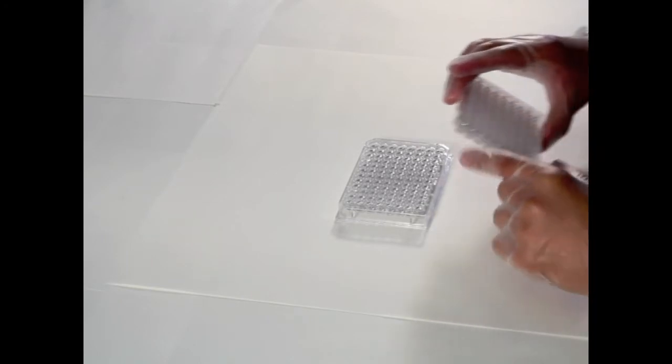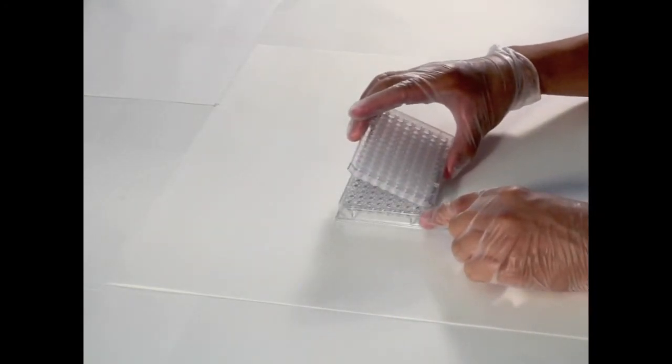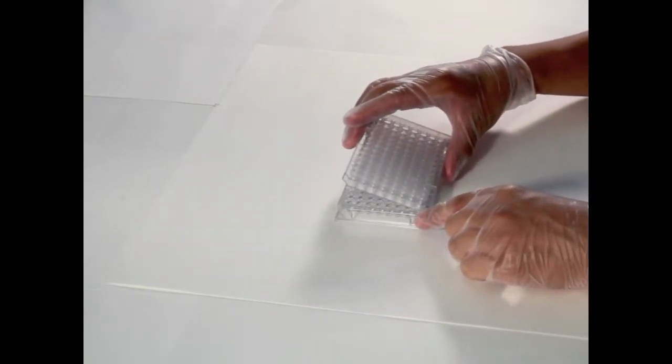After hydration, the top plate is separated from the support plate and placed on top of the acceptor plate within 3 minutes.